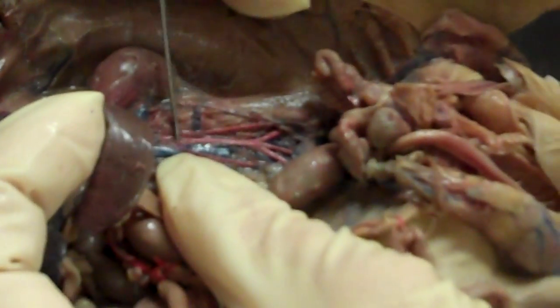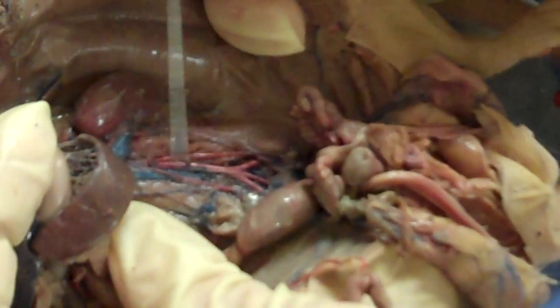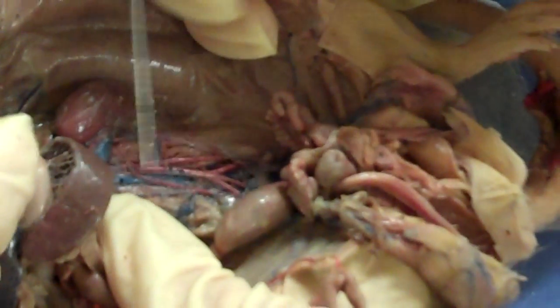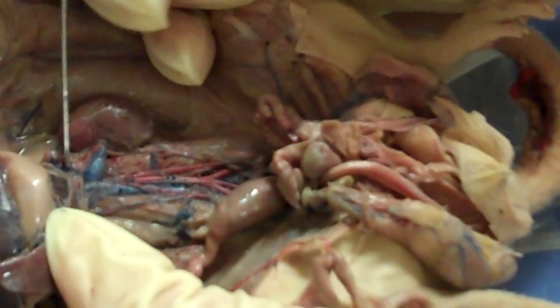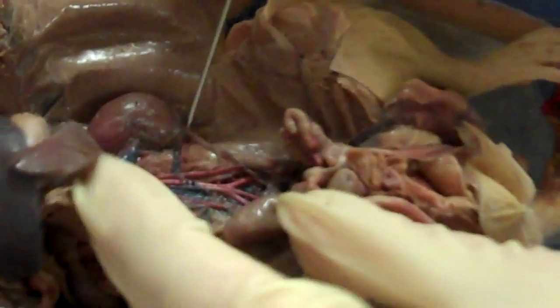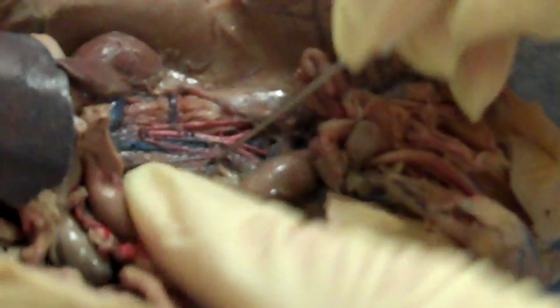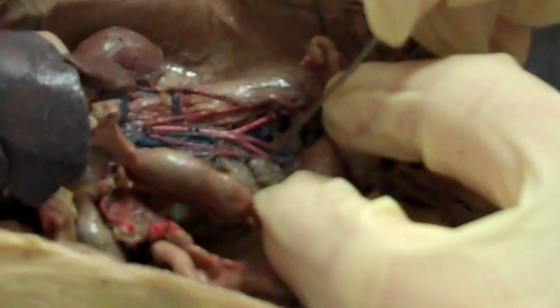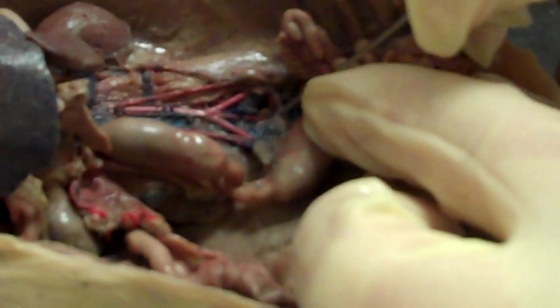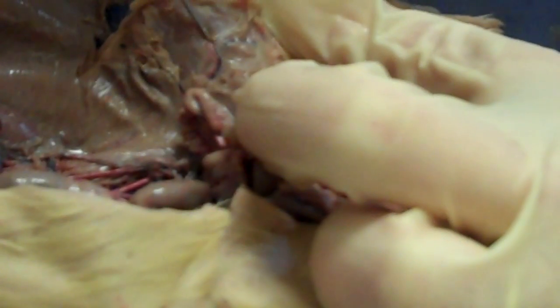Looking at the abdominal vessels, this pink vessel running down the dorsal body wall is the abdominal aorta — the major artery in the abdominal cavity. The blue one running parallel with it is the caudal vena cava, the major vein. The vessels going to the kidney are the renal vein and artery. Going up to the adrenal gland, you have the adrenal vein and artery. Down here, this branch would be the left iliolumbar vein and artery, and over here the right iliolumbar vein and artery. At the bottom where they fork, you have the common iliac vein and arteries — right and left. This one going straight down is the caudal artery. In the thigh itself, you see the femoral artery and vein.